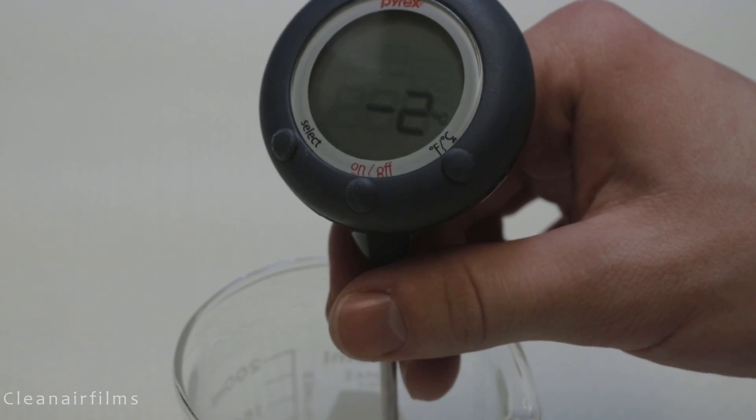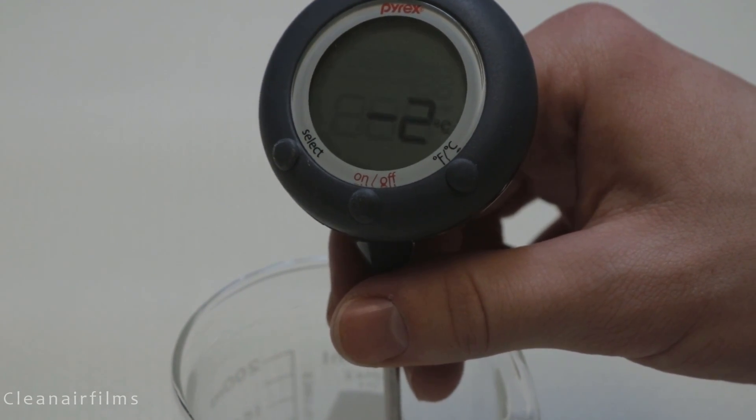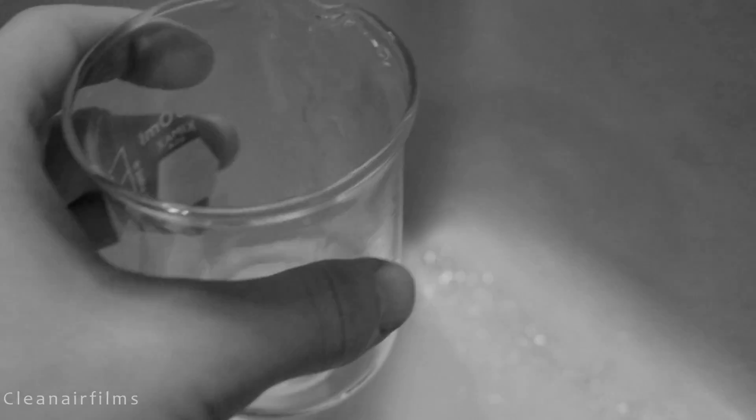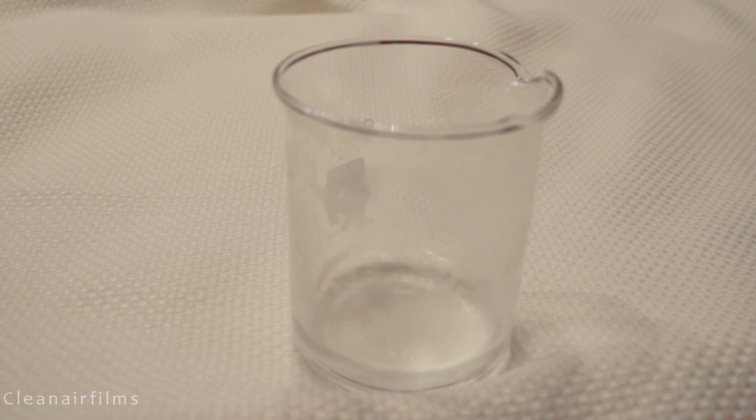Let's test its temperature. It is negative two degrees Celsius. Earlier I also put plain water in the freezer for an hour to compare. If you notice, the plain water is frozen solid.